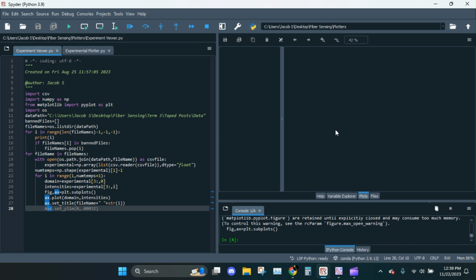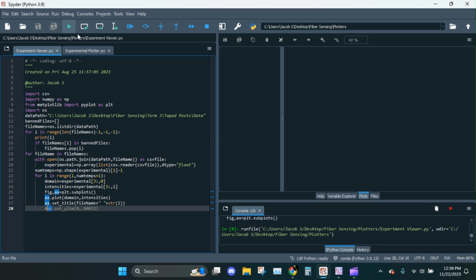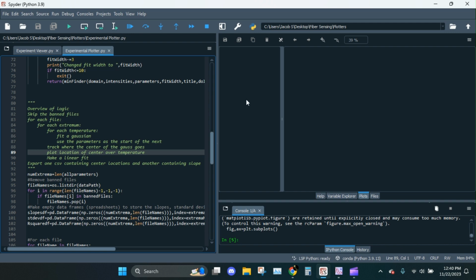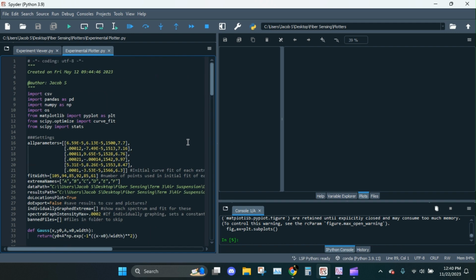I'm going to run it one more time just to make sure that everything's good. I'll probably cut this one out. Let's see. Great. So we know that peaks didn't appear or disappear or go off the side. So that's that phase done. Now we go over to experimental plotter. This is the big program that does all of my analysis.